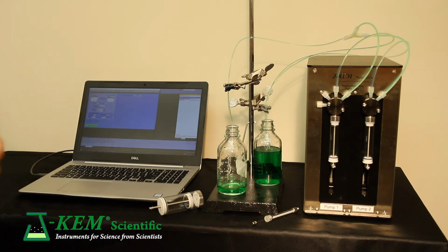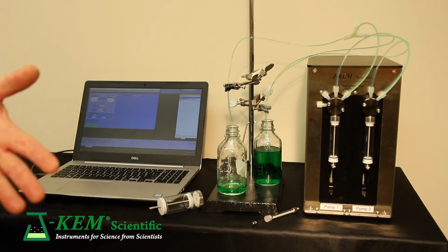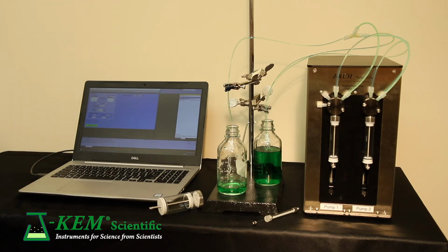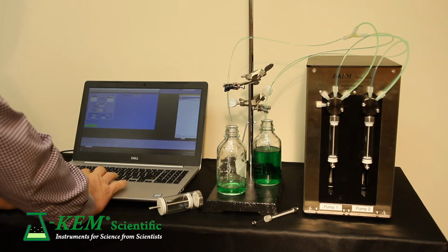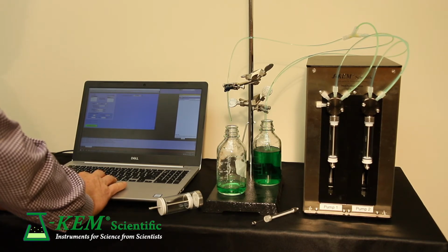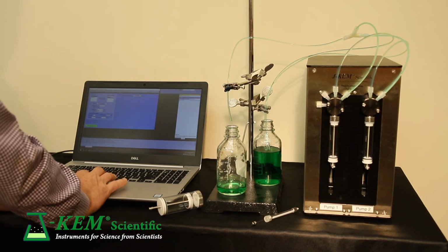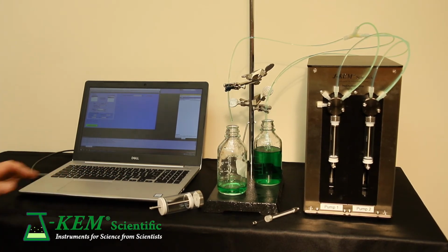In most cases, that short pause in refilling is fine, and so most chemists can use the single position syringe pump. Some people cannot. Sometimes some applications need really, truly uninterrupted flow, and that's what you can achieve with a dual pump system. So for this run, I'm going to do a dual pump addition. I'm going to increase the volume just a little bit more, so we'll have time to watch it. And then I'm going to run the exact same experiment.